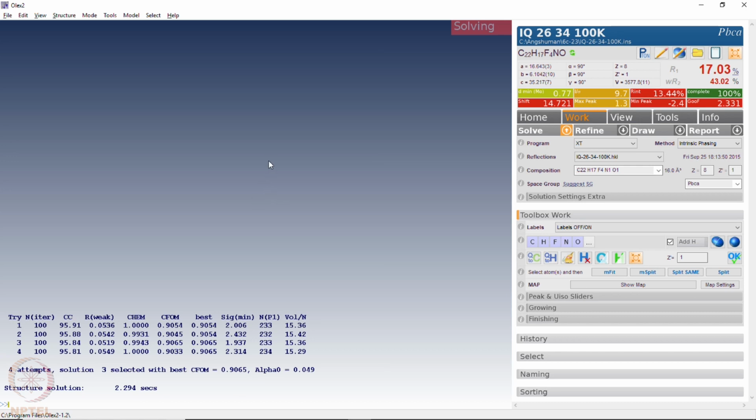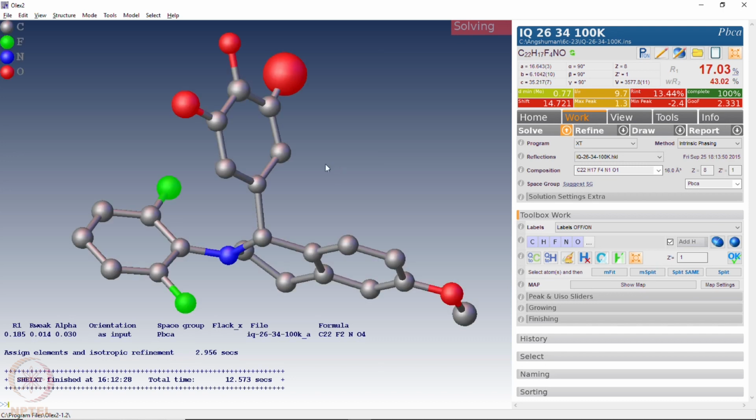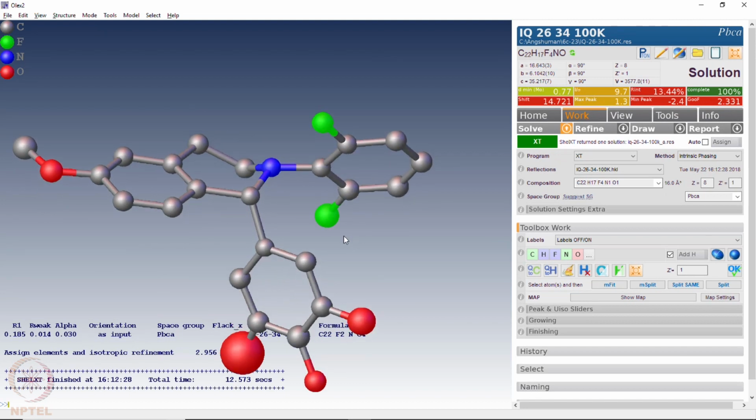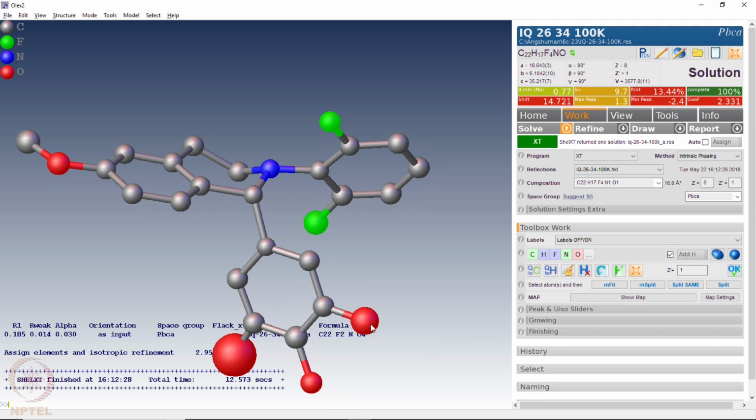it will quickly give you a structure which is the starting model for this solution, where you will see that the molecule is coming with one very large ellipsoid, another small ellipsoid and a very small ellipsoid here. With my chemical knowledge, because we know what molecule we made, we now know that there are two fluorine atoms, one here and one there. Only these two should have been the fluorine atoms, but here also one large electron density is appearing and the software is thinking that it may be oxygen.